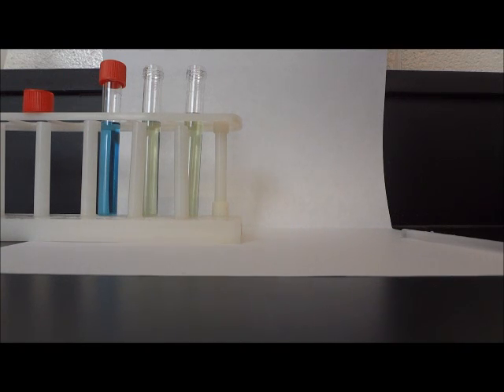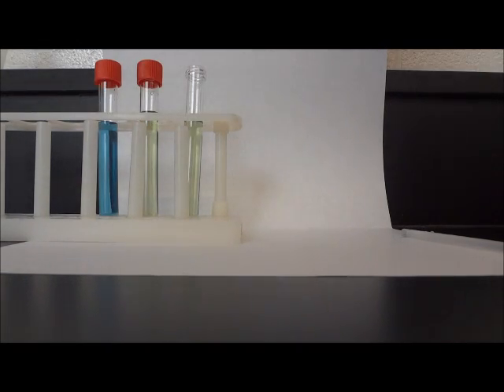I have now added 10 milliliters of the different colored solution to each of the two remaining test tubes. I am now going to cap one of them to keep it as my control. This control will show the carbon dioxide rich solution compared to the two other test tubes. Now that I have both of my control test tubes capped, I can begin the last part of this experiment.